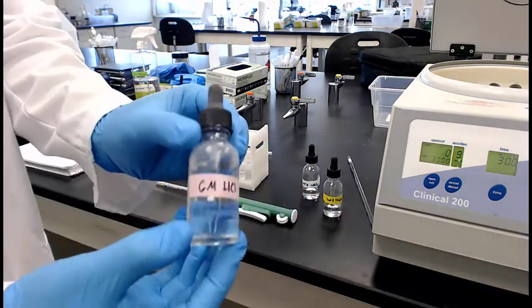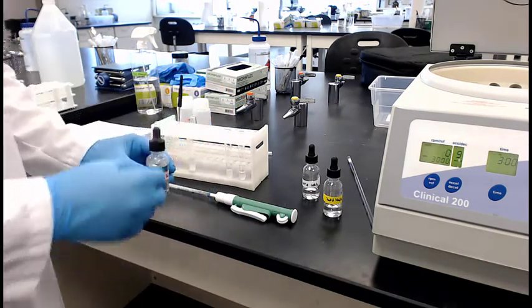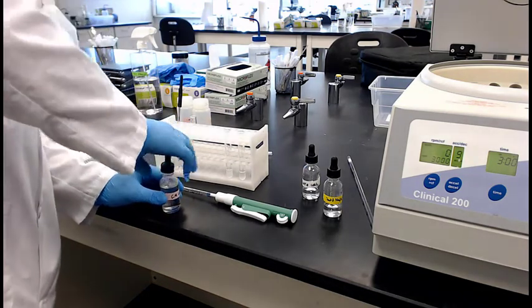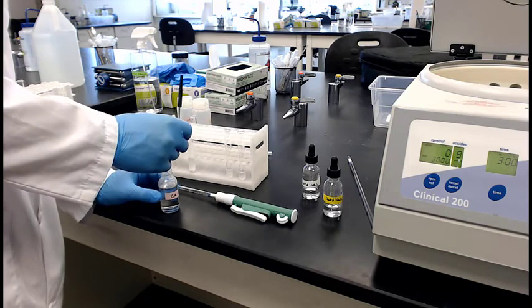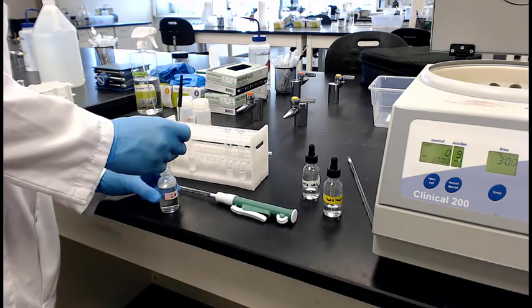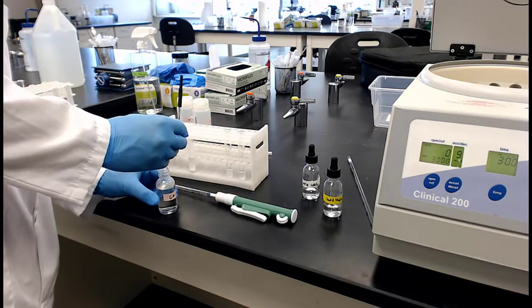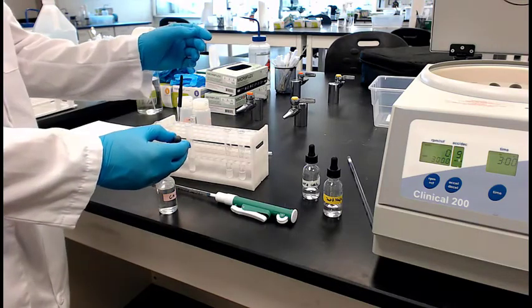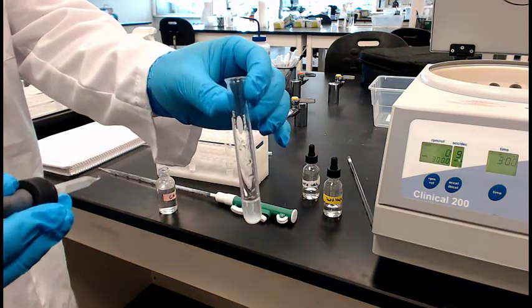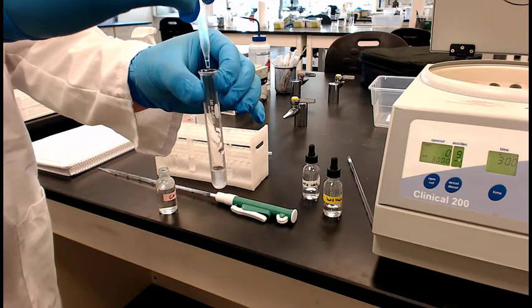So now we're going to work on step 7. We're going to take hydrochloric acid and we're going to add it to a solution that has both the clear filtrate above and the precipitate below. So there we go. Really important to have your gloves on at this time, right? So there you can go. See this precipitate at the bottom and it's clear up above. Now watch, you add that in there.